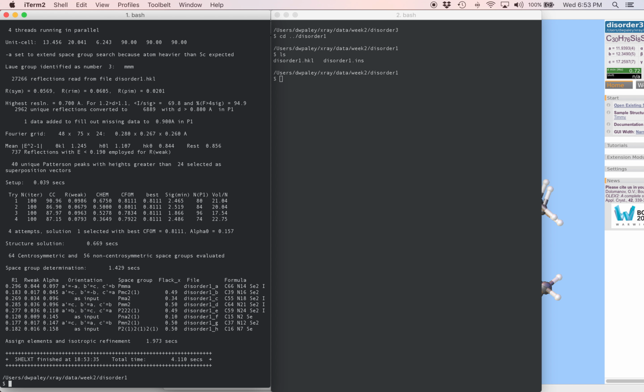So this is an example where SHELXT is going to give us more than one possible space group. Sometimes you just have to go down the list and look at them and see which one looks right, but this one gives us a pretty good hint of which solution is probably the best one. The R factor on the far left is the result of a quick isotropic refinement that SHELXT is going to run on each one of its proposed solutions.